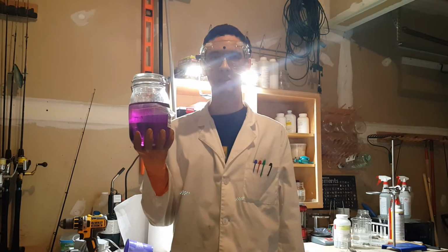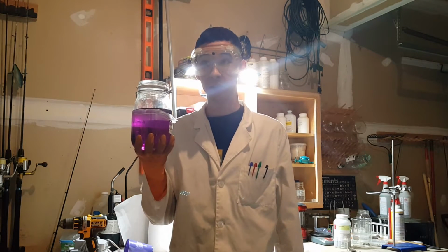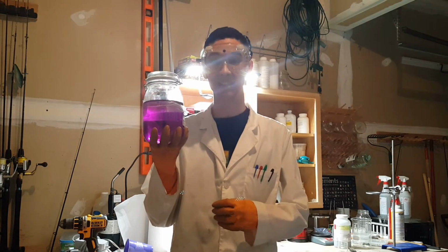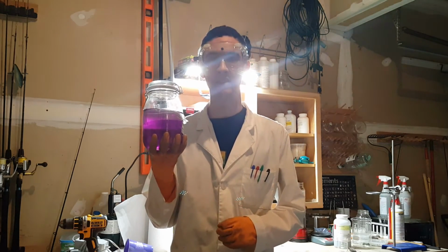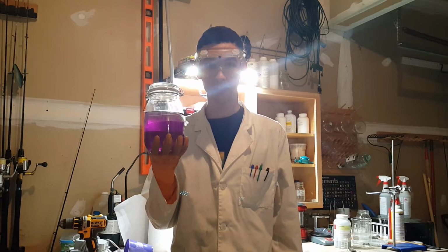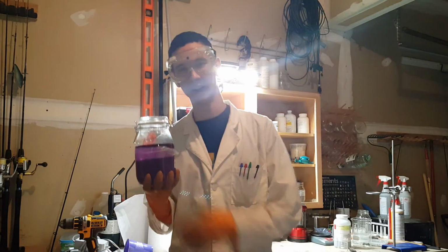So today I'm going to be showing you the manganese chemical chameleon experiment. We're going to be preparing a solution that changes colors over time. The substance that causes the color change is the manganese ion. Manganese has many stable oxidation states, and when it changes oxidation states, it also changes colors. So let's get to the science behind it.